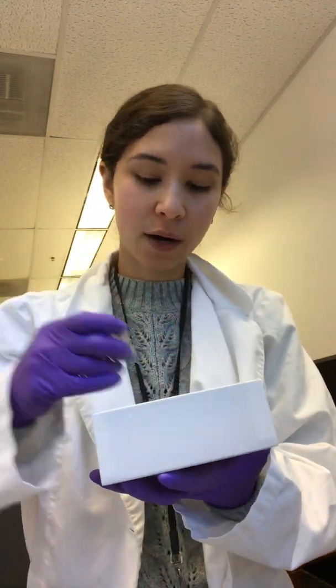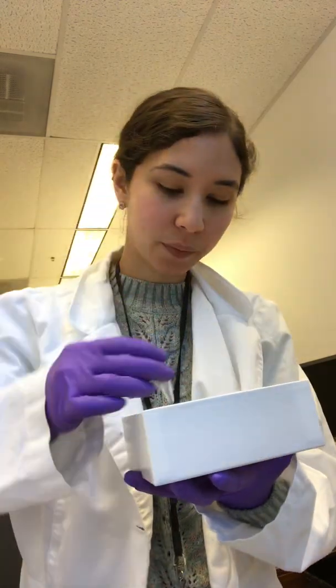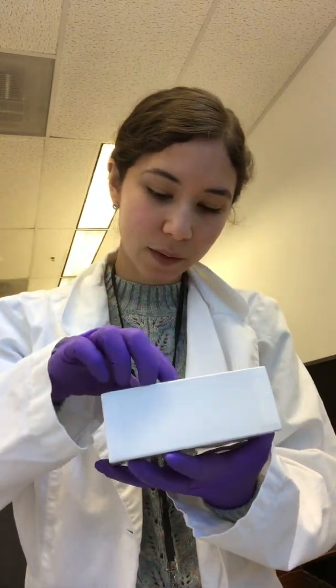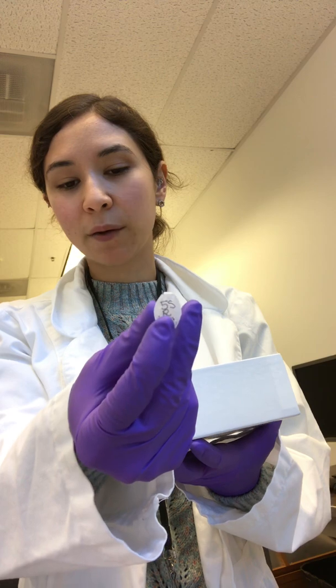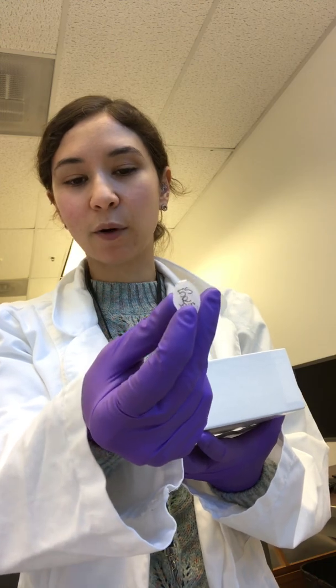We have our H2O, our 10x buffer, dNTPs, and our forward and reverse primers. So here's our 5S primer, our reverse. There's no N next to it, so we know it's our initial reverse primer, and 10 micromolar. I also like to write that on the side as well, just in case things get messed up. We also have our Taq in here, but I like to leave our Taq in the box till the last moment because we don't want to risk contaminating the Taq. The Takara Taq is super expensive, so just leave that in the box till the last moment.